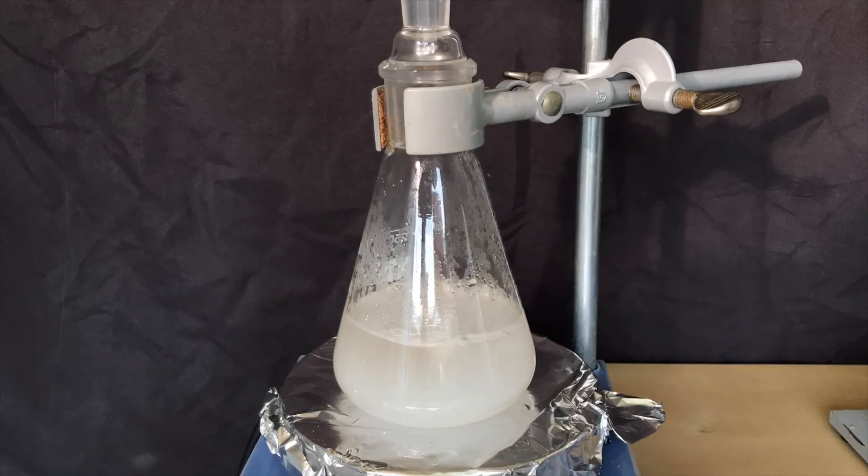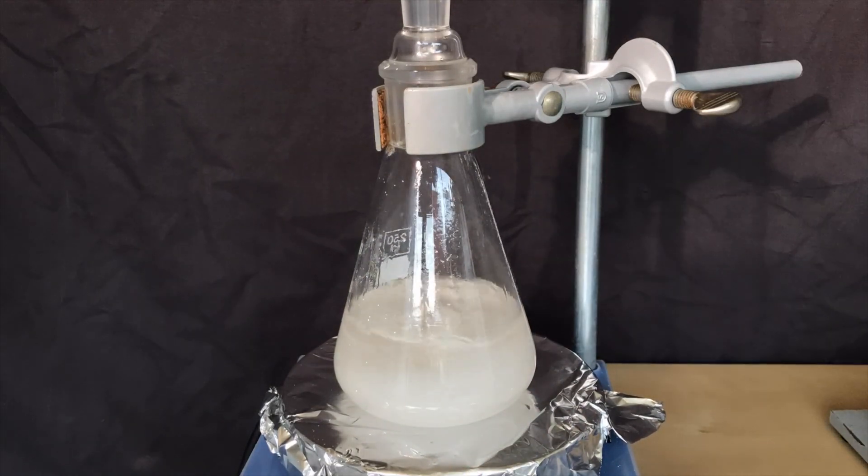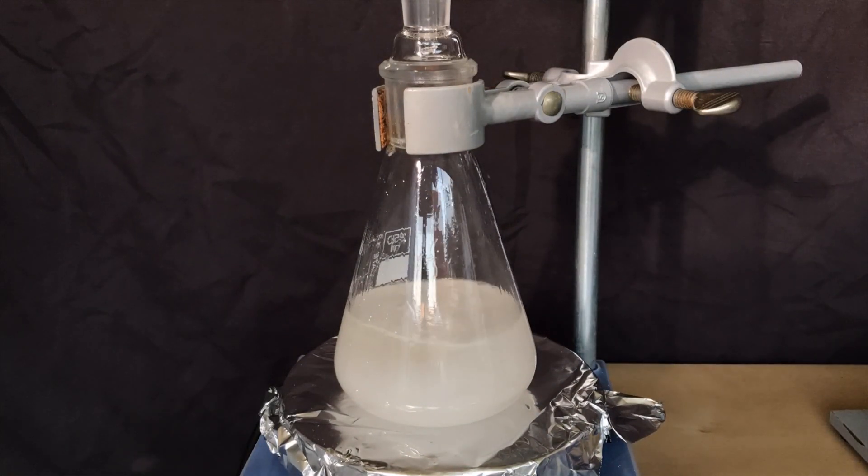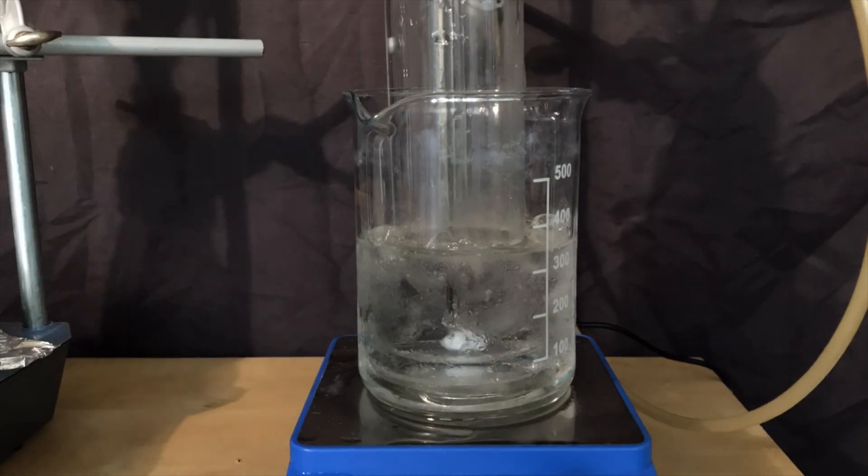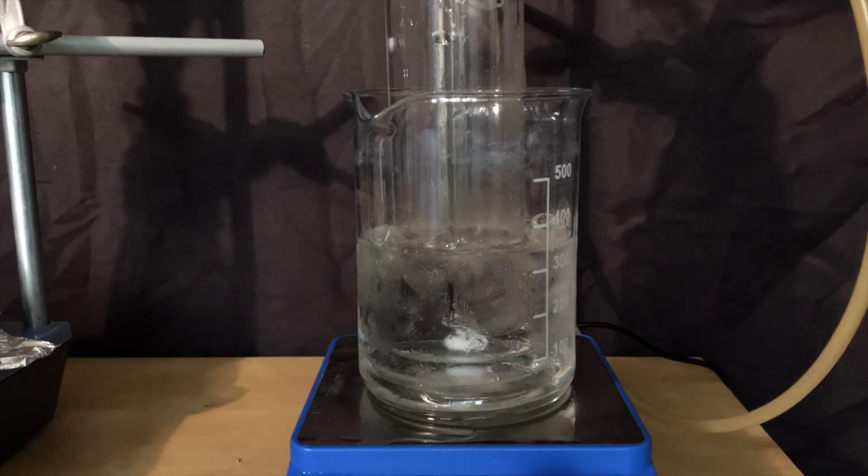The first bubbles that came over didn't dissolve. Why? This is probably still air and the apparatus needs to be purged. At some moment we will get a lot of product and the bubbles will start to dissolve.